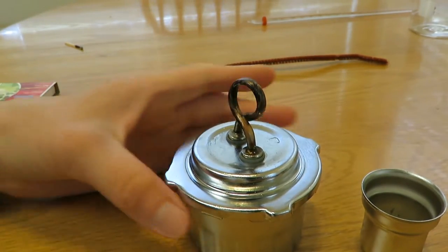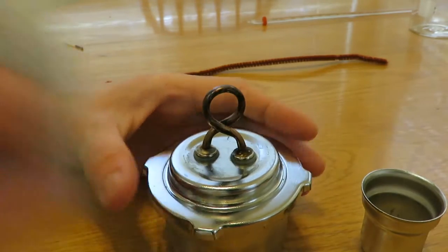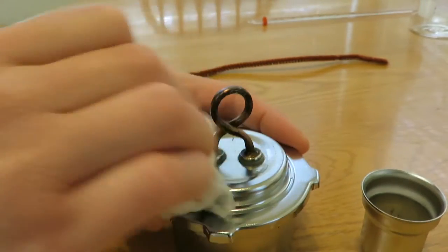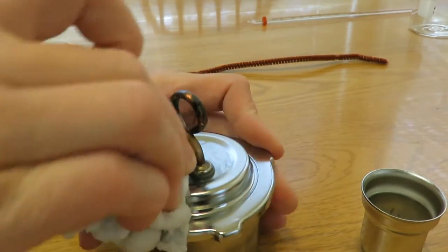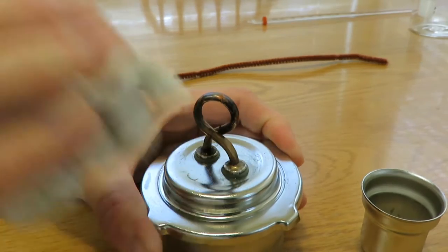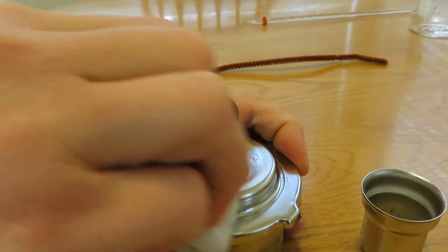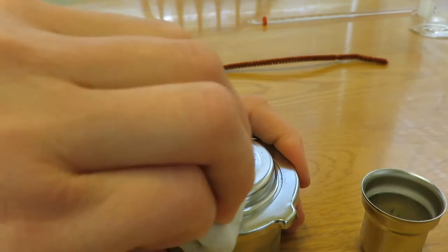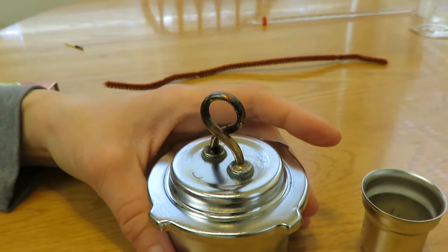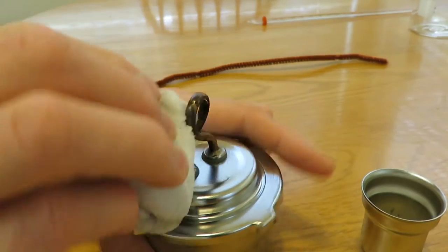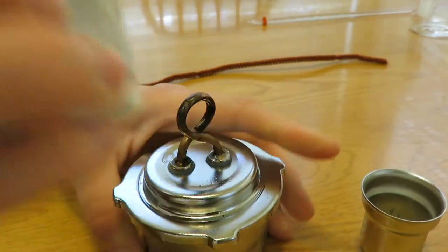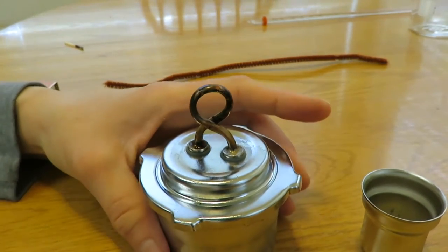I'm thinking instead of waiting till I've used this five times, maybe you should just clean it like this after every use. That way you don't have the extreme buildup that we're getting at this point. It's one of those things - I'm lazy about it. The experiment's over and I put it aside until next time, and then you worry about it not doing what you need it to do. If you're more careful than I am, you won't even have this problem because you'll be taking care of it right from the start.